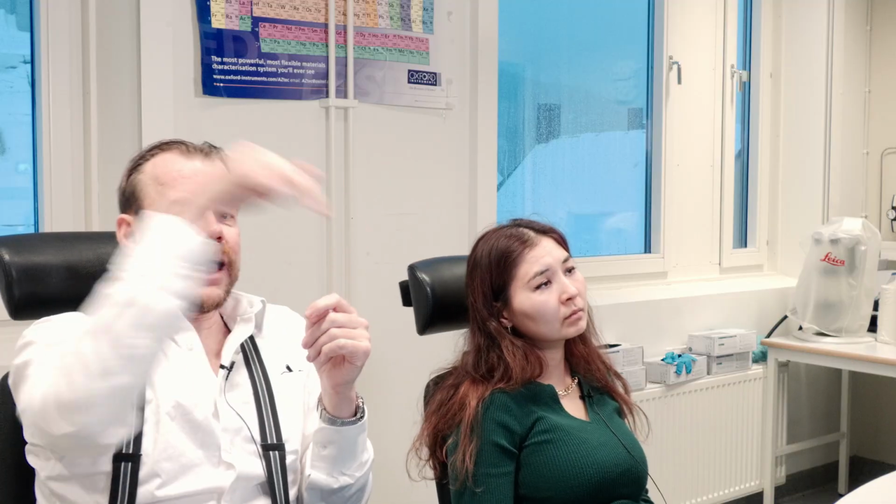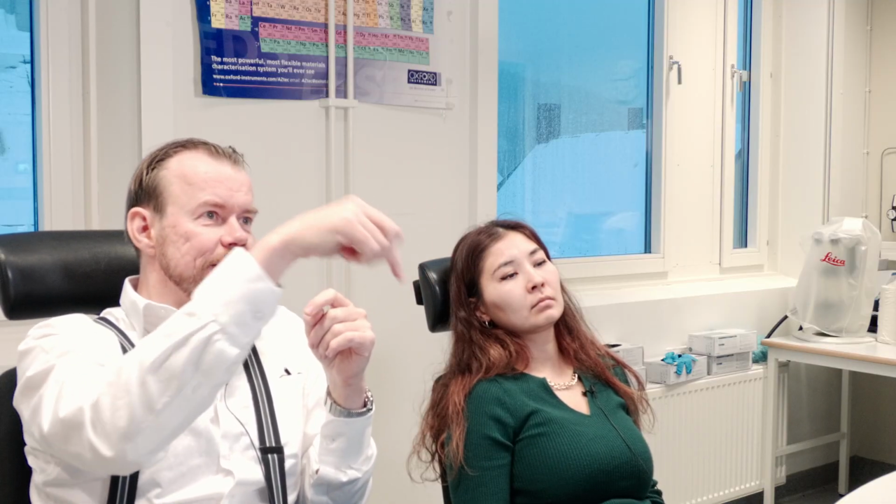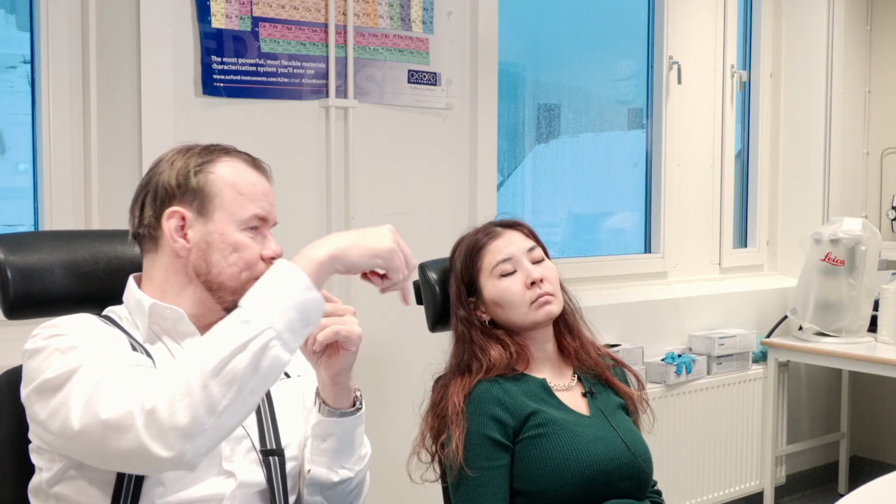But if we scan a bigger area and take the average of that, since the beam is moving around, there will be less carbon at each place the beam scans. So we reduce the carbon issue. Another point of doing the area thing is that if the sample is beam sensitive, we don't start to drill a hole with the beam in one area. We spread out the energy on a larger surface, which is also nice.